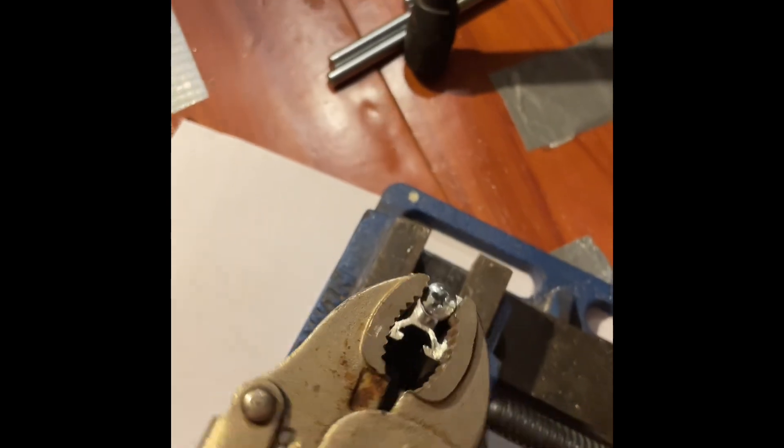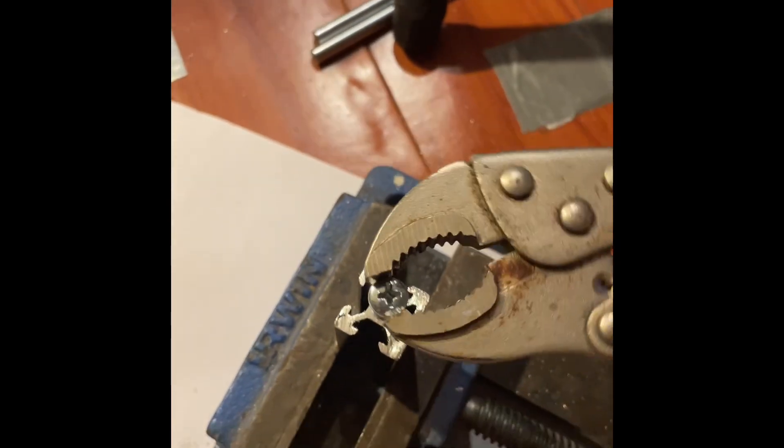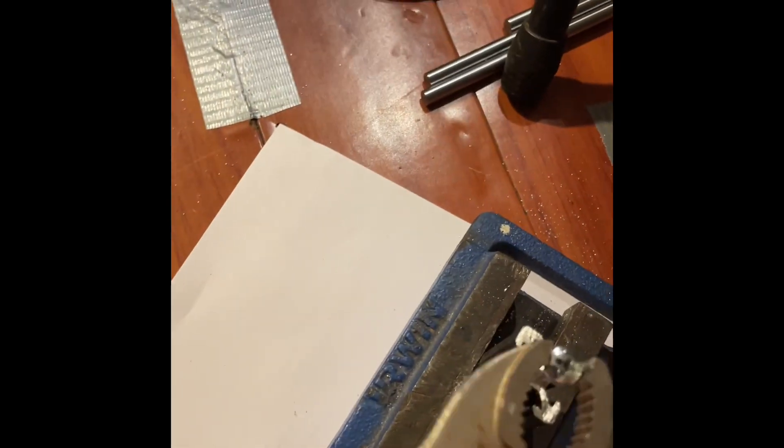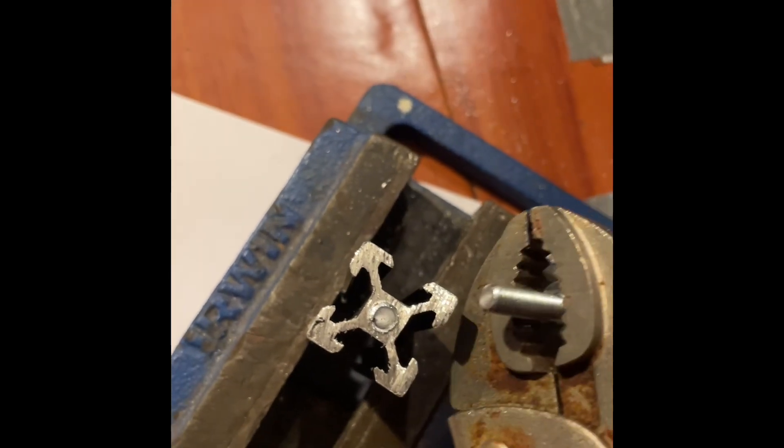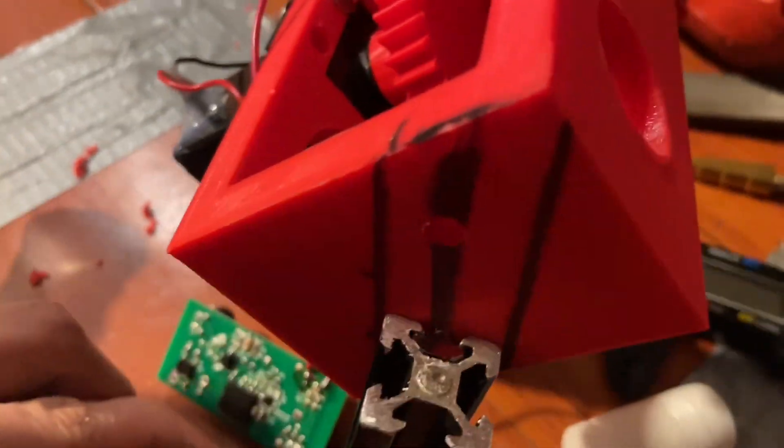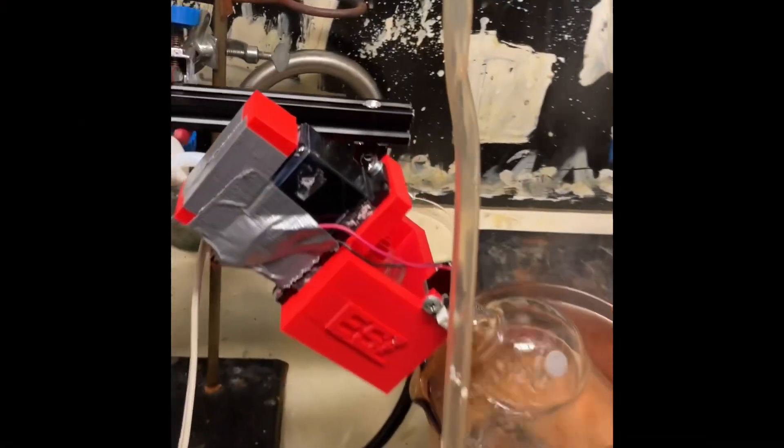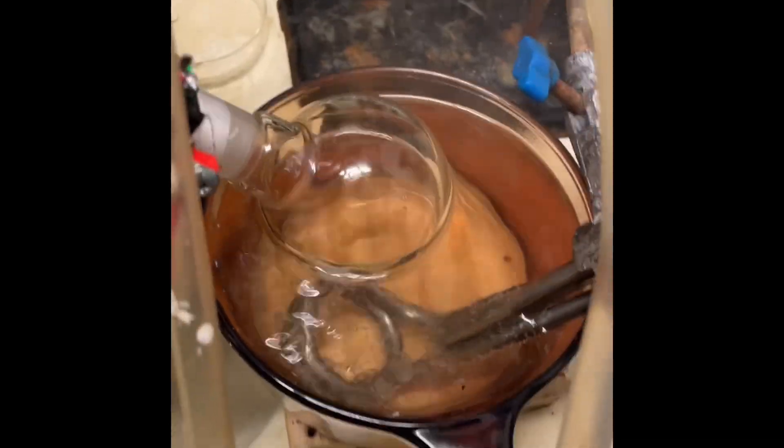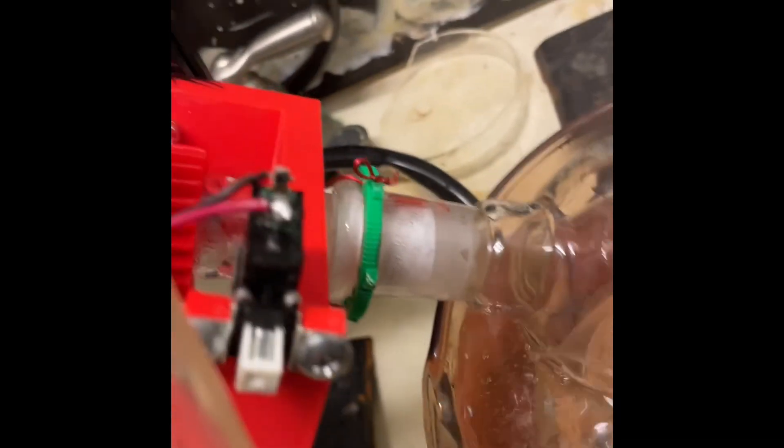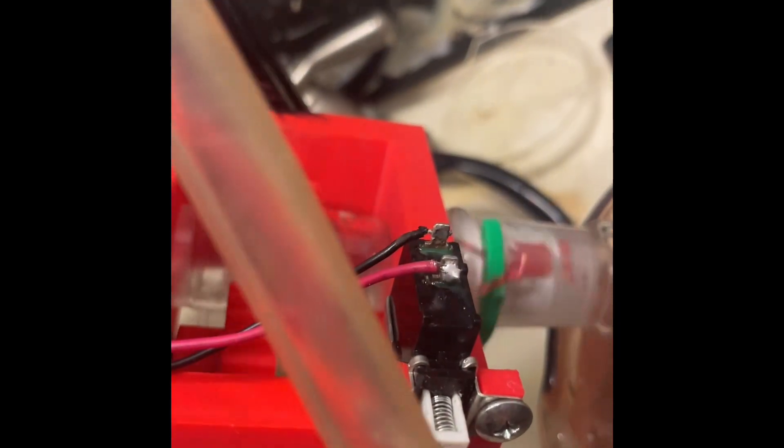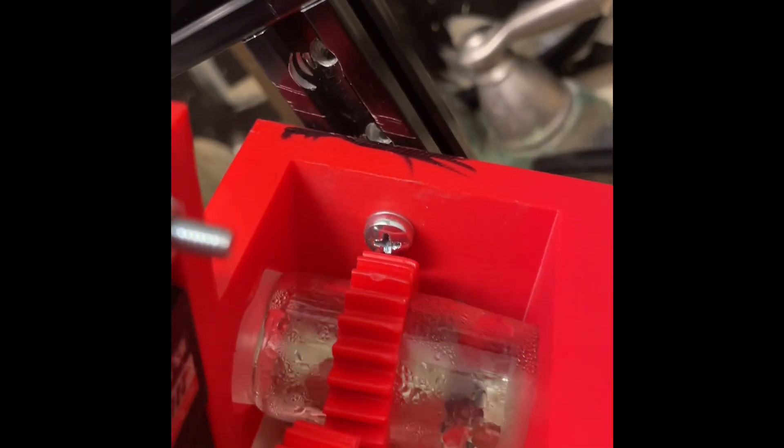I made a little stand out of extruded aluminum. I'm not going to show you how to mount this, you can do that yourself - mount it to a wood board, lab stand, extruded aluminum, whatever. This design is poorly designed, I encourage you to make your own using this as an idea.